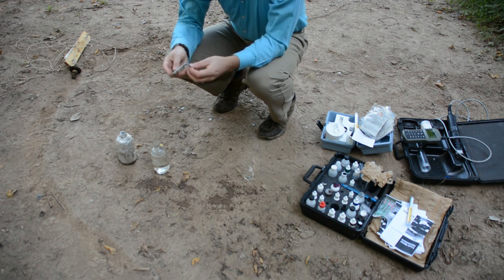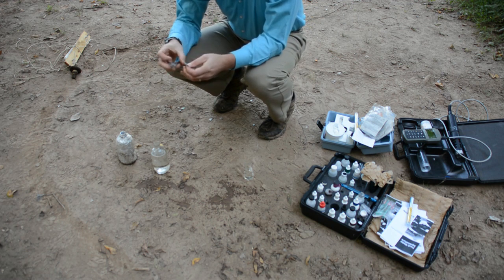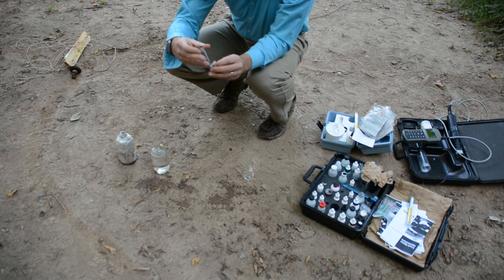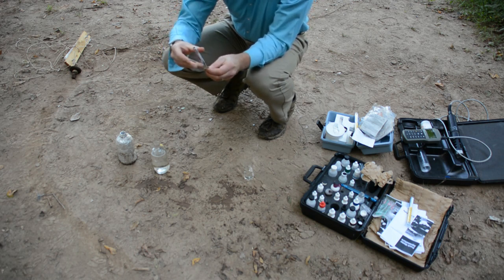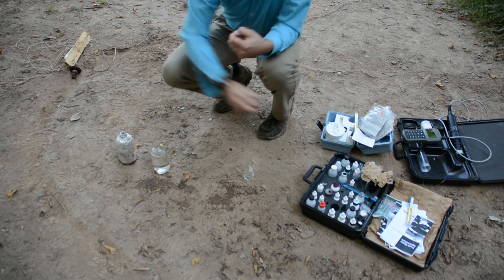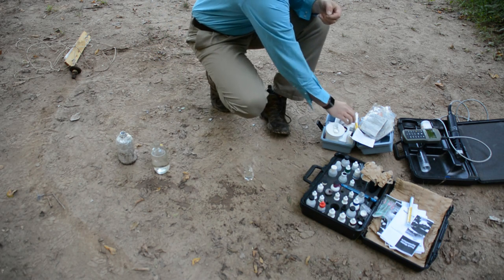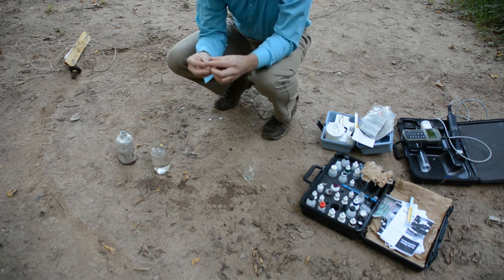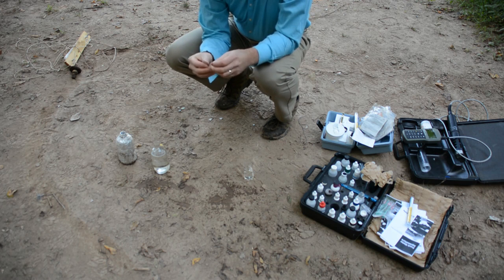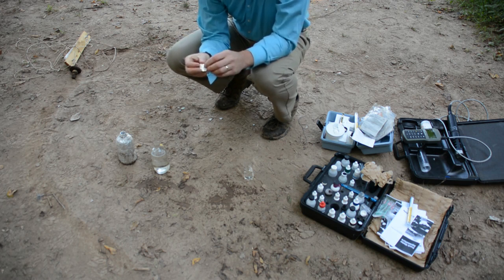It says tear, but it's very hard to tear, so we've got some nice nail clippers here. They do the trick. All right, just kind of cut it, which allows us to rip them open. I'll take all my trash out, so I'm just going to pack it in the container right now. Open these guys up. Pillow pack number 1 starts.